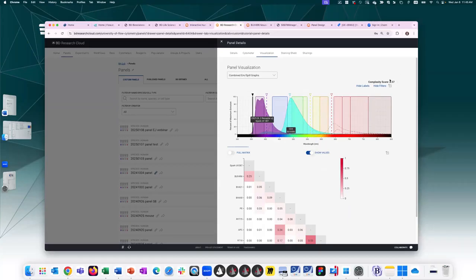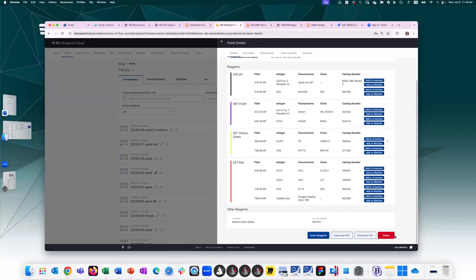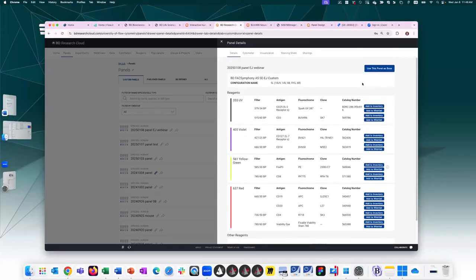You get reminded of the complexity score. So here in the details page, you can use this panel as base. It would restart the same 5-step process, but it would pre-fill it with your previous choices. So you cannot modify an existing panel. This is a set panel, but you can always use it as a base, and you can always delete this panel if you no longer want it. So you can use this panel as a base and restart with these pre-filled options.